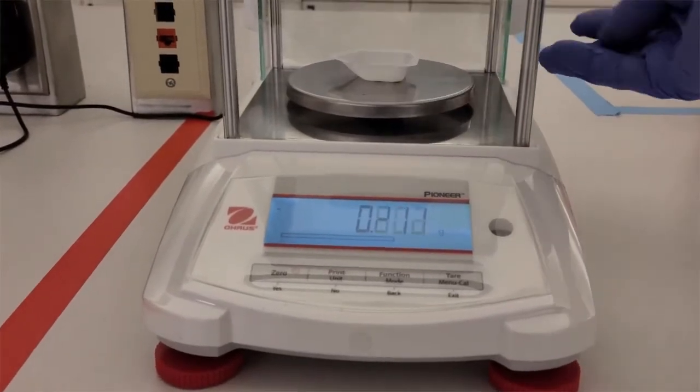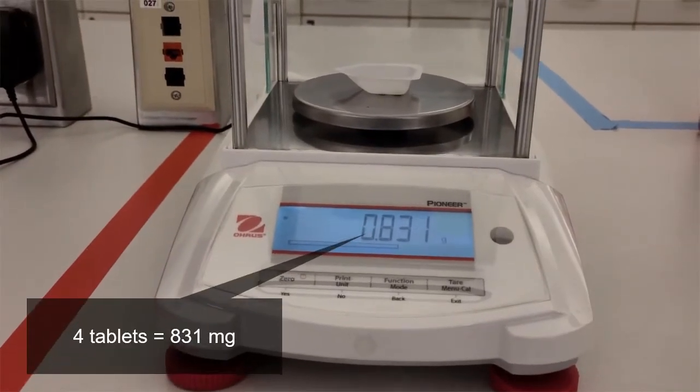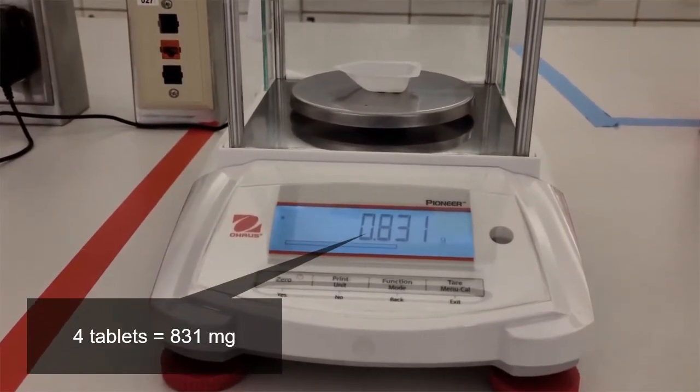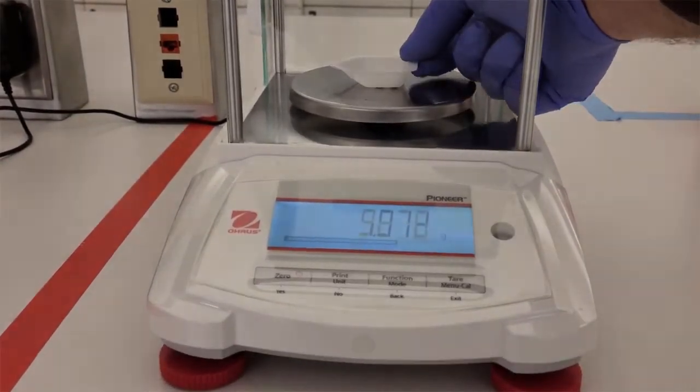So there's one, two, three, and four tablets. And those four tablets together weigh 831 milligrams. Now, I know in that 831 milligrams is my 40 milligrams of drug, but I only want 35.